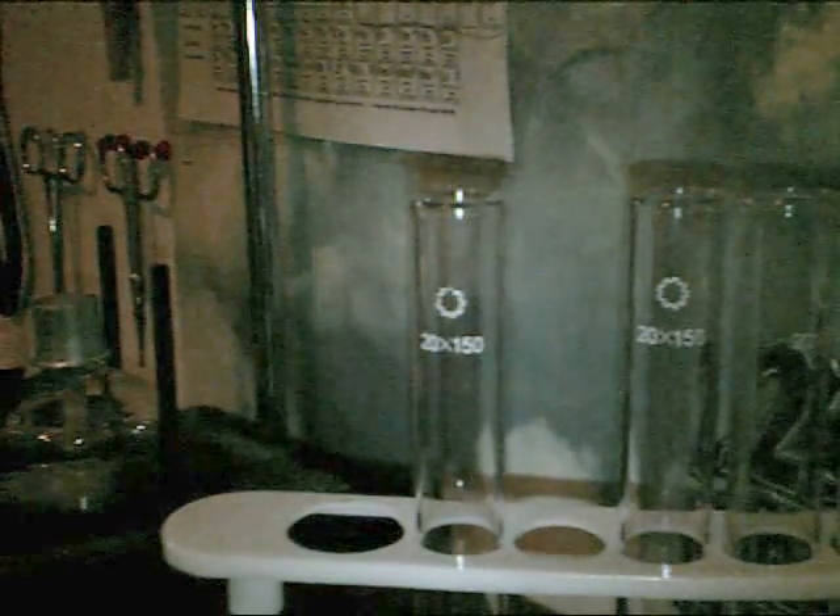So now I have to leave the test tube to cool for a few minutes — I'll be back. Hello, this is NerdAlert226, and I'm back. As you can see, we have much, much less hydrogen peroxide than we started out with, and that tells you that it is more concentrated than it began with. If it started with about 10 milliliters and we bring it down to about 2 milliliters, then it's probably concentrated to around almost 20% purity.